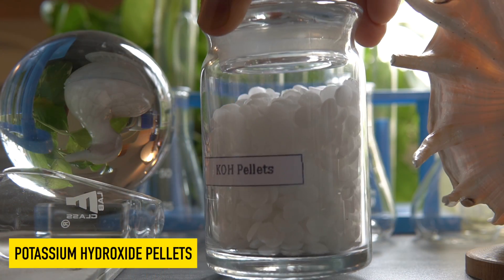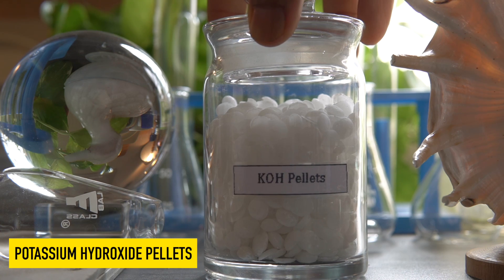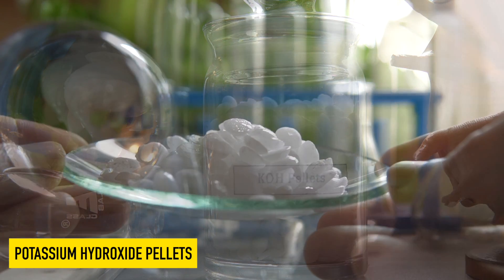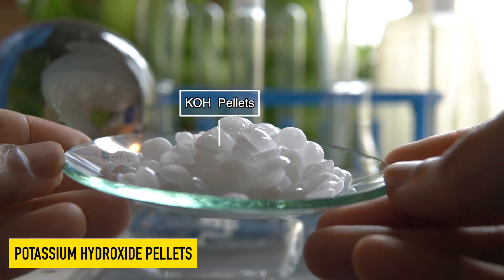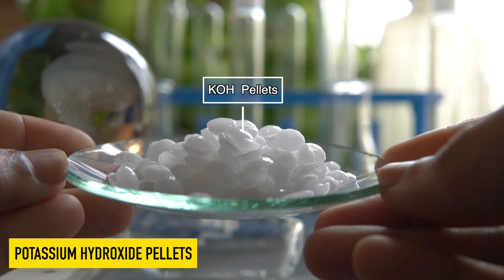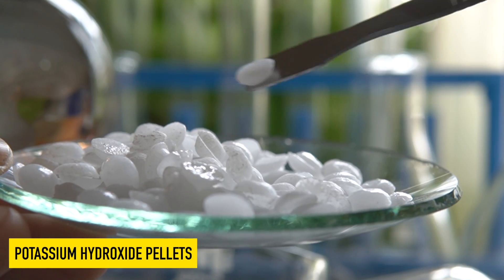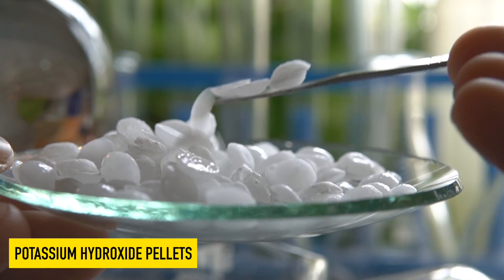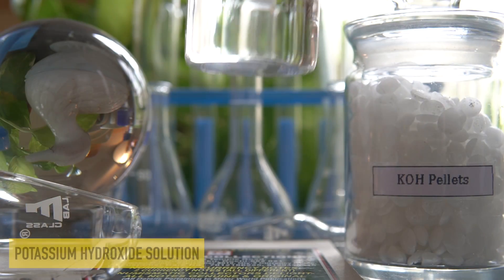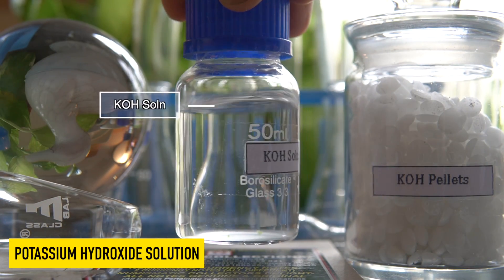These are KOH pellets. They are also a hygroscopic substance, meaning they can absorb moisture from the air and dissolve in it. The reaction of KOH pellets with water is highly exothermic, and they can easily dissolve in water to make a homogeneous solution.